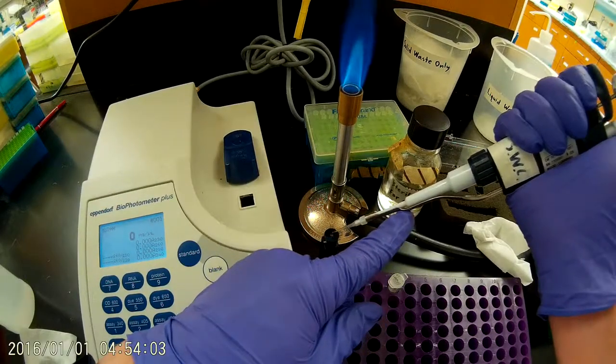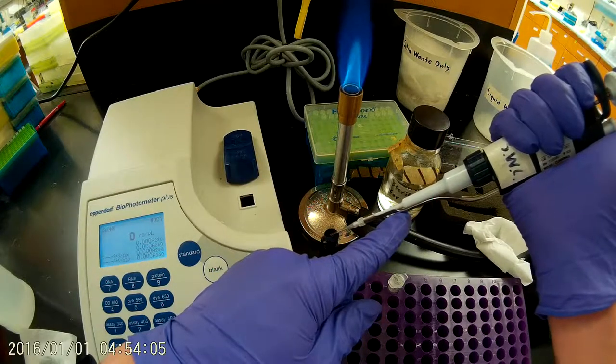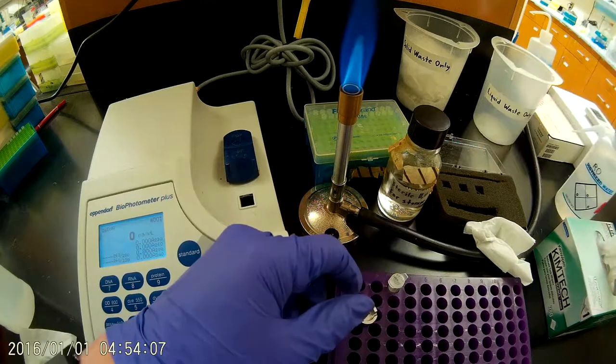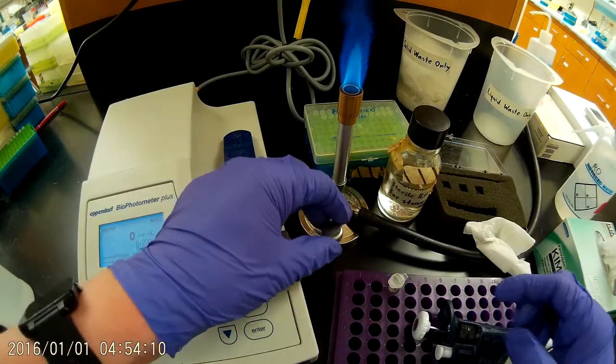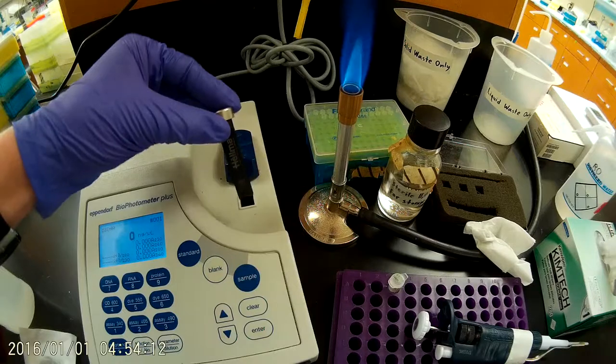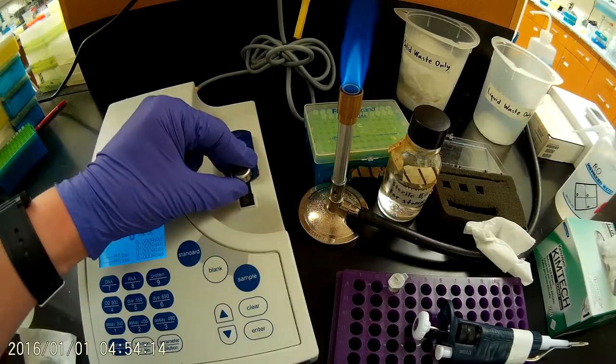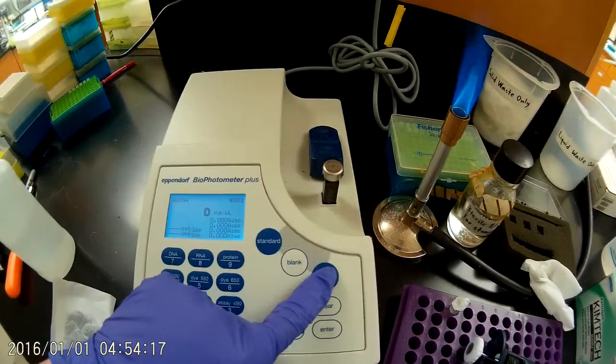Okay, so I'm going to dispense that out onto the surface of the tray. Again, making sure that the text is facing towards me. Pushing it all the way down, and press sample.